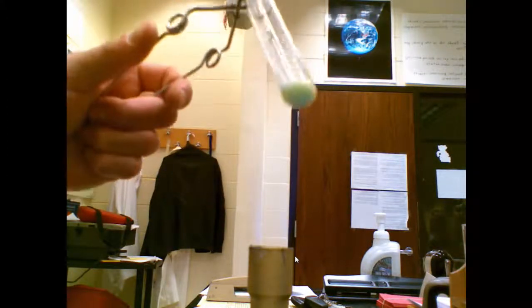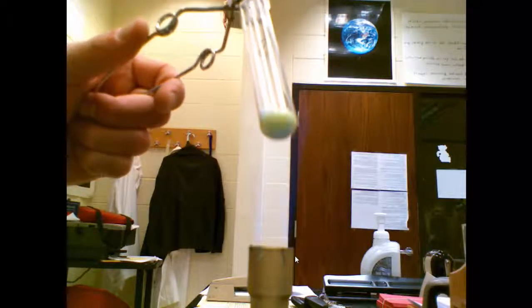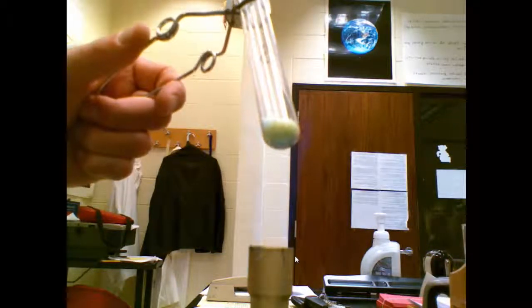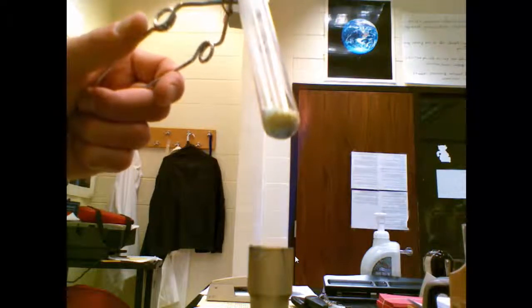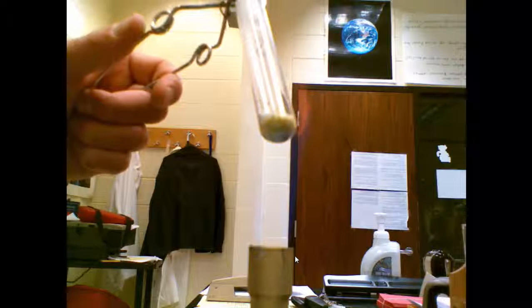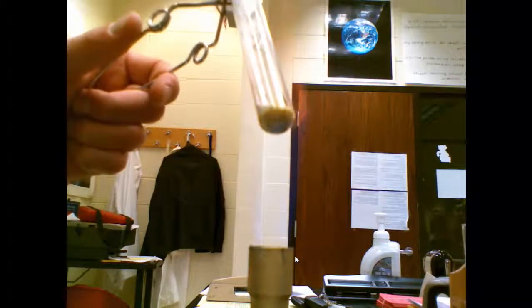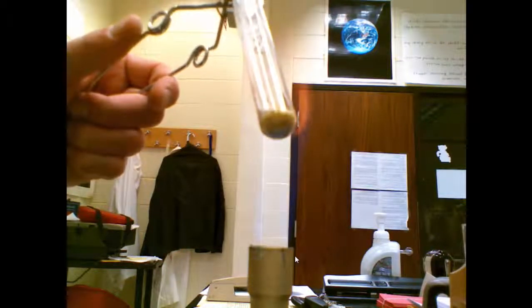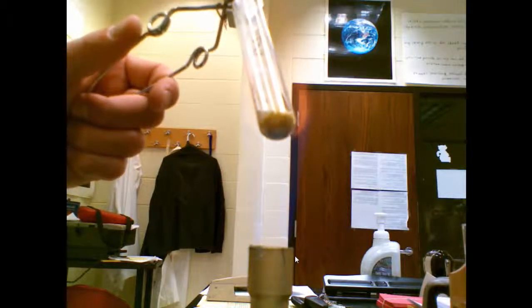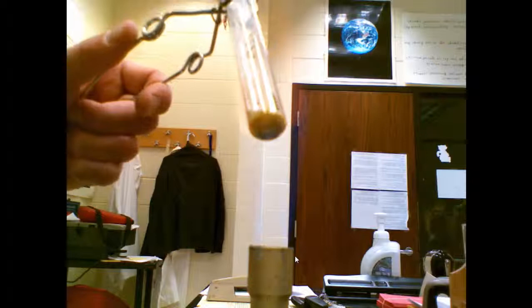This is crystal number eight, a greenish granular crystal. It's been in the flame for a little bit, no melting. I'm just starting to see a hint of yellow. You can see the yellow around the base of the test tube. Still no melting. So I am not able to melt this sample in our Bunsen burner.